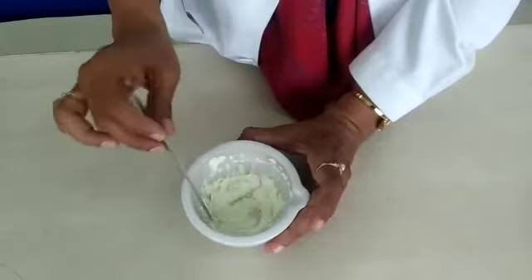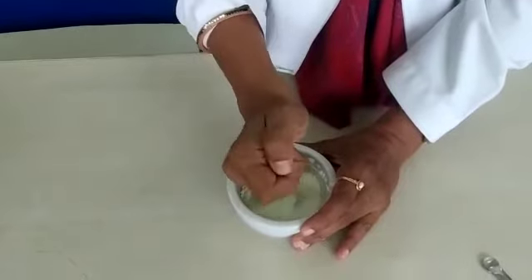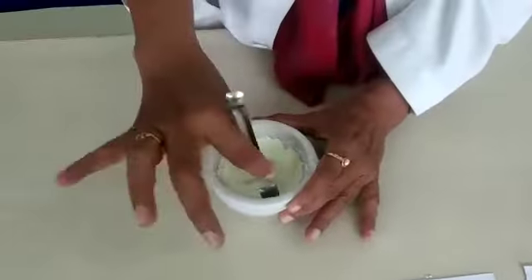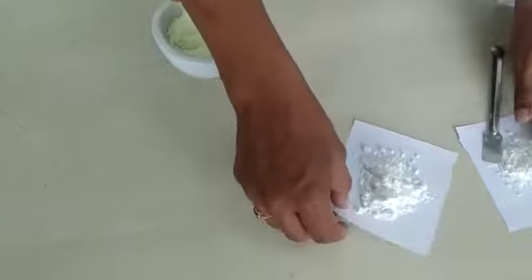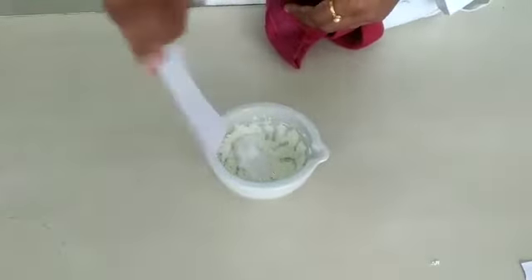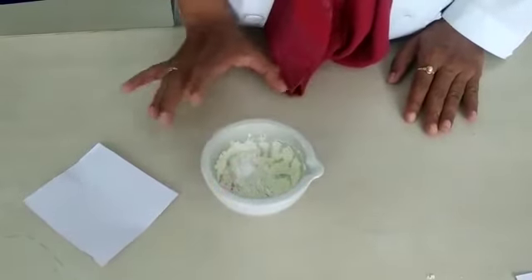For the last 1 minute you are going to mix the drug substance using the blade end of the spatula. This completes your 10 minutes. After the first 20 minutes you add your second portion of 3 grams of sugar of milk into the mortar and repeat the same procedure. After 1 hour your 1x potency — sulphur 1x — is ready.